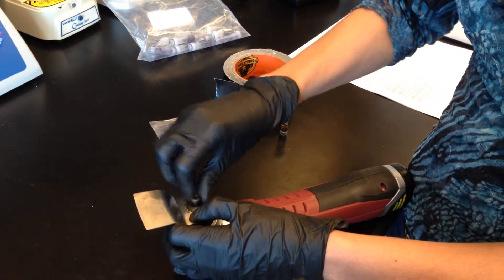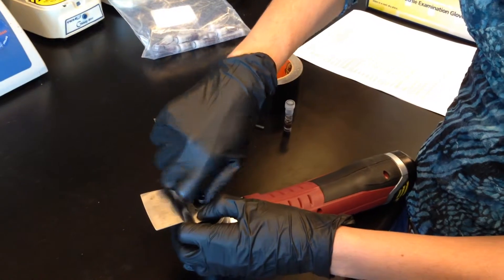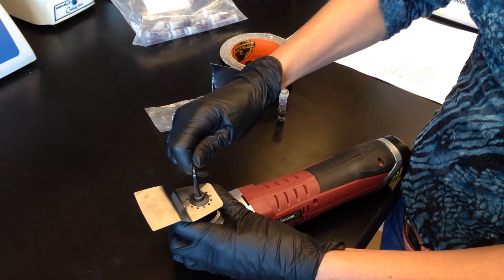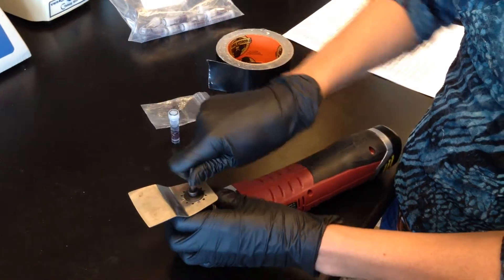Obviously this is not what this tool was designed for, but it's a useful way to have a bead beater in places where you don't have power or can't afford a bead beater.